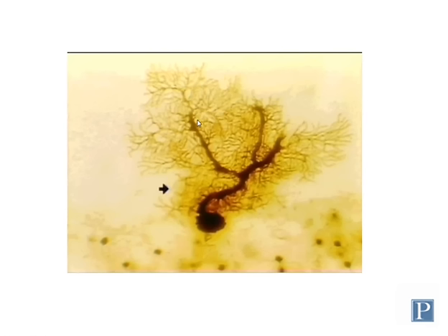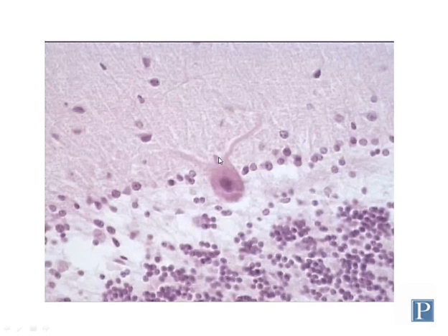In order to actually visualize the structure of a Purkinje neuron in its entirety, as you can see here, it requires use of a different stain. This is a silver stain or Golgi stain, which can be used to really show the complex morphology of a single Purkinje cerebellar neuron. So the advantage of the stain, obviously, is that it shows a lot more detailed structure of an individual cell, because with H&E, you're only seeing the major parts, the major thick branches of the dendrites and the cell body, but all the rest of it is lost.